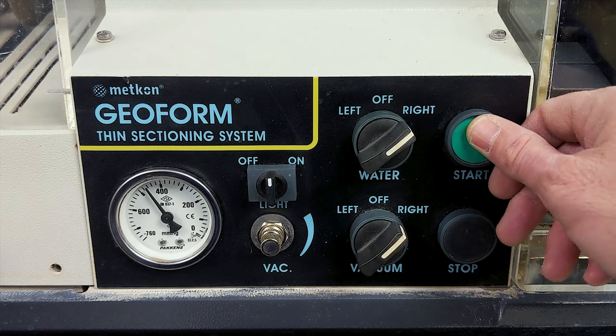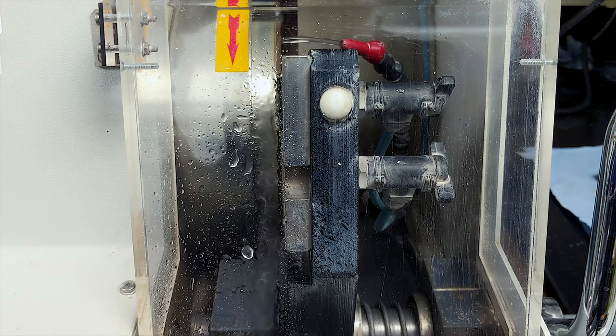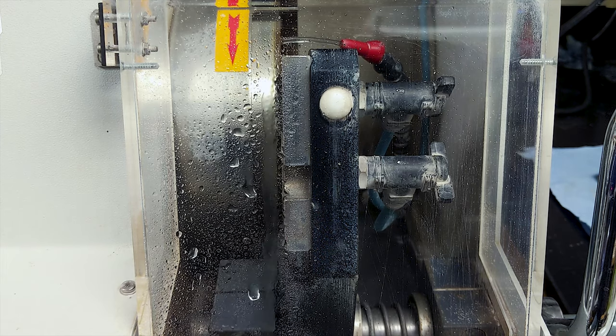Once both switches are aligned, the start button activates the motor for cutting or grinding. When finished, the stop button deactivates the motor.